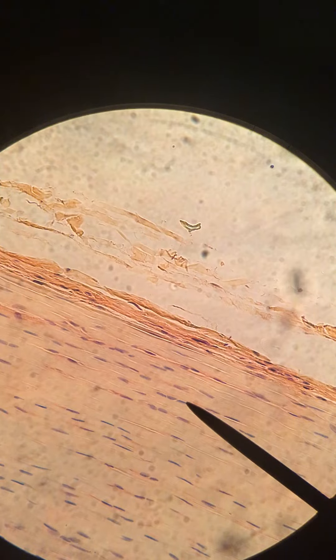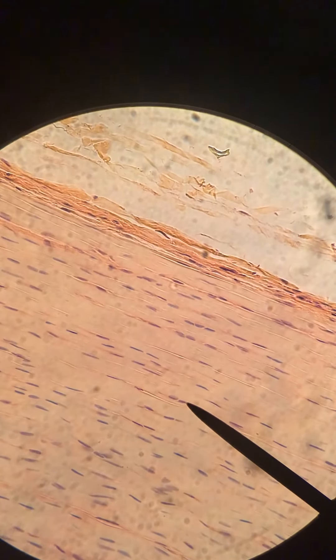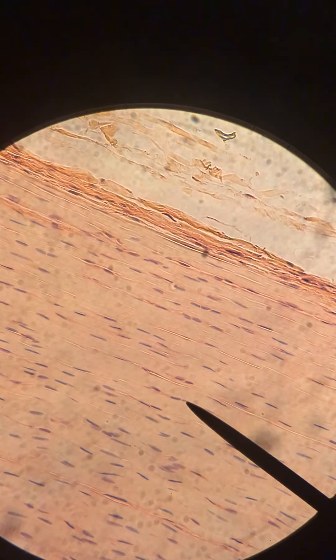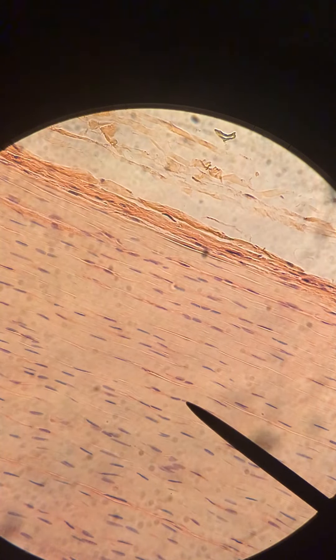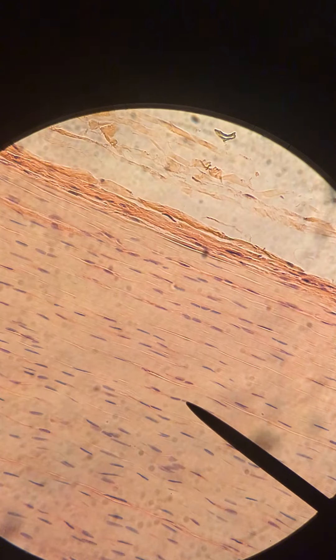You can see here there's three in a row, and if you look down below there's two in a row. Here's another instance where there's two or three in a row. This is characteristic of regular dense connective tissue, as opposed to smooth muscle where you would not see that type of orientation to the nuclei.